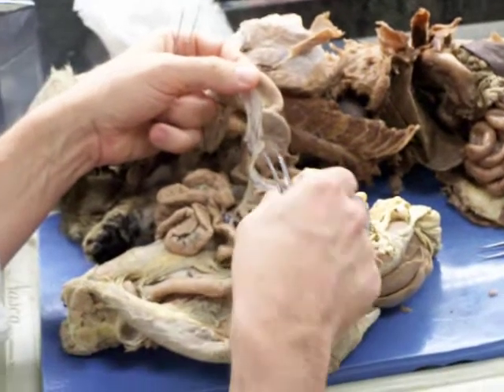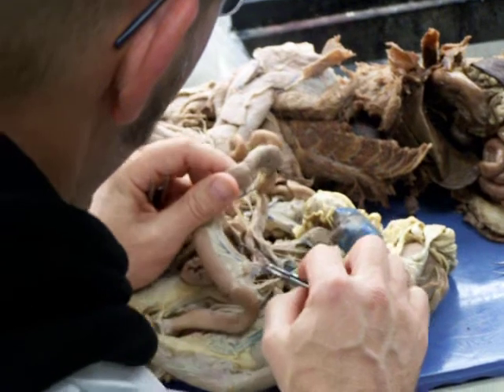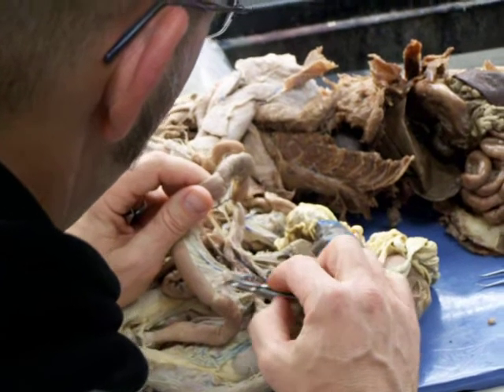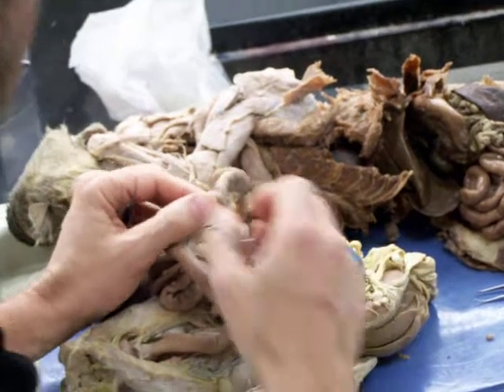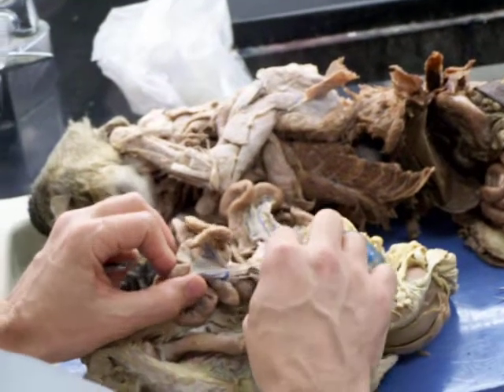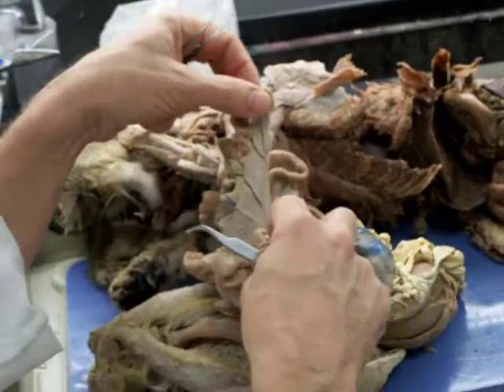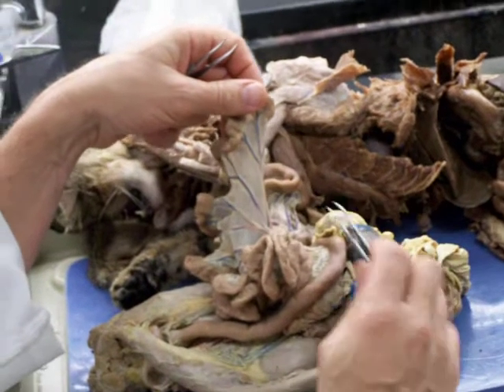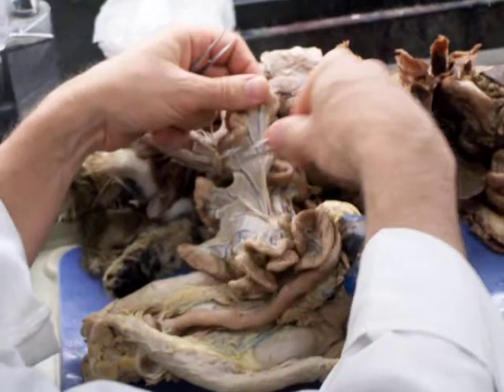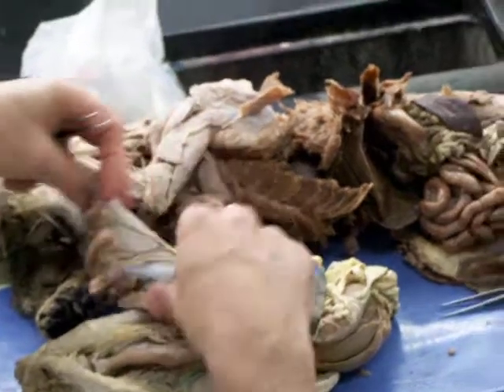Where is the iliac now? Not iliac, ileocolic. Right here, you can see this come out right here. Okay. There's a branch there, there's another big branch right next to it, and those are distributed all throughout here. And then up in this connective tissue, you can see another large branch here that gives rise to lots of little branches that go to most of the small intestine. All of these are jejunal arteries. They're just kind of lumped together, and they fan out through the mesentery. So there's lots of jejunal arteries going to the bulk of the small intestine.